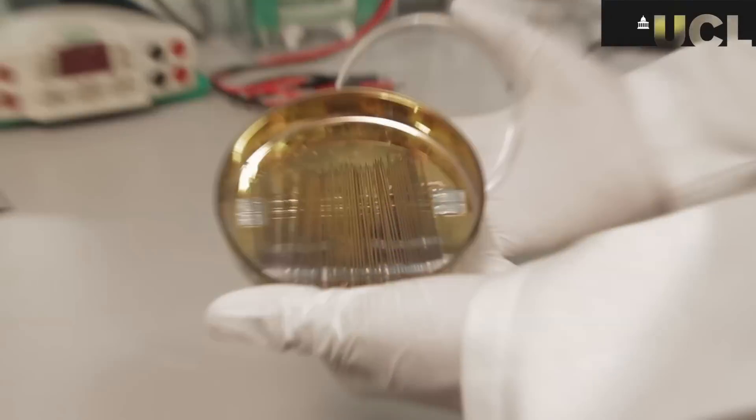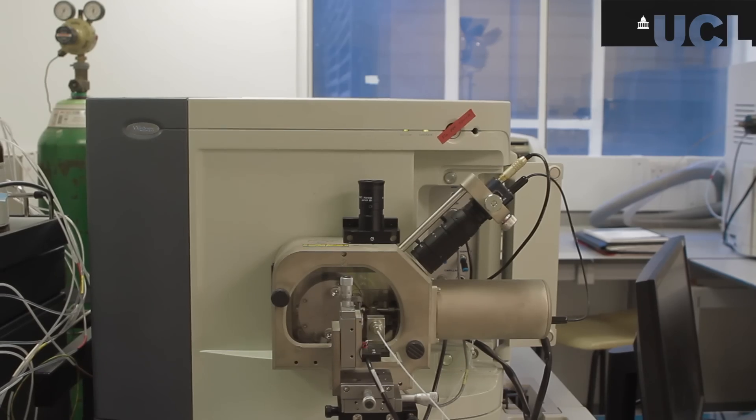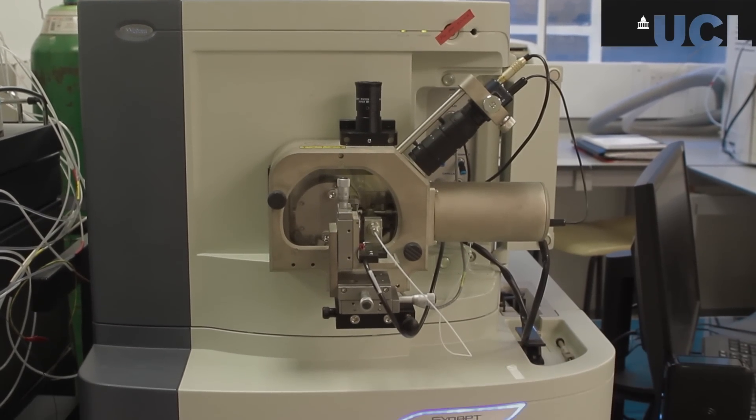And here's the final finished product of the needles. They're all gold coated and ready to be used for electrospray.